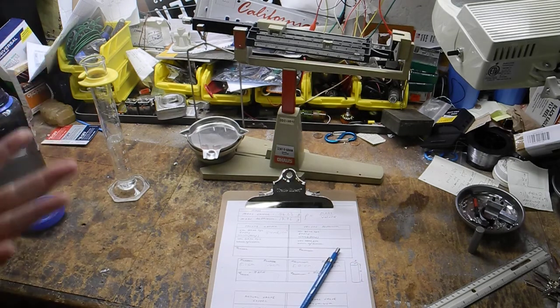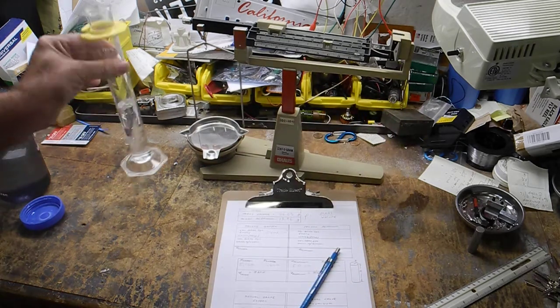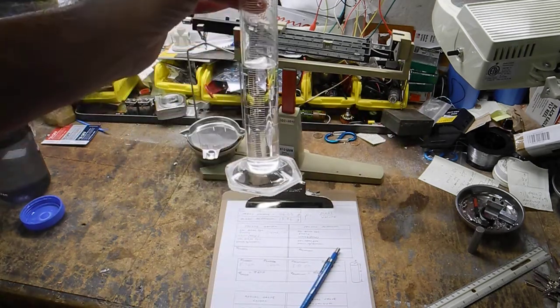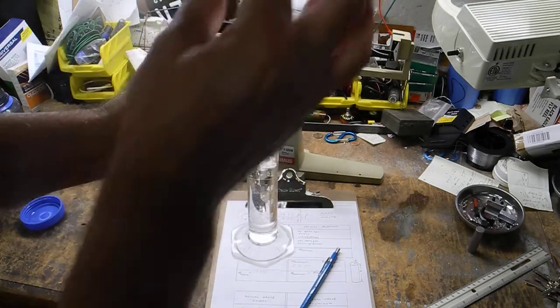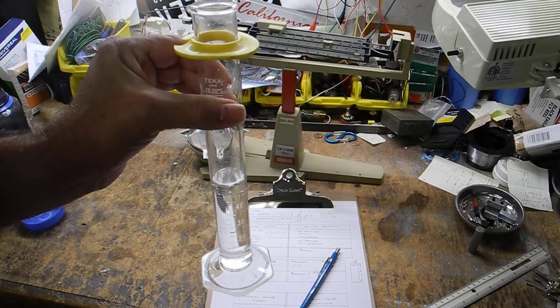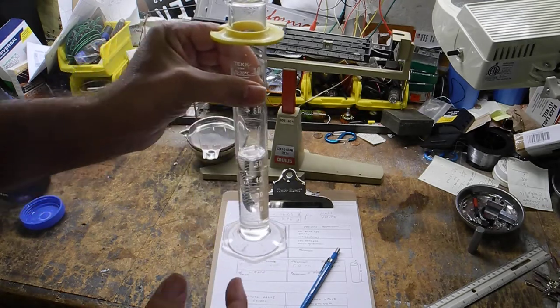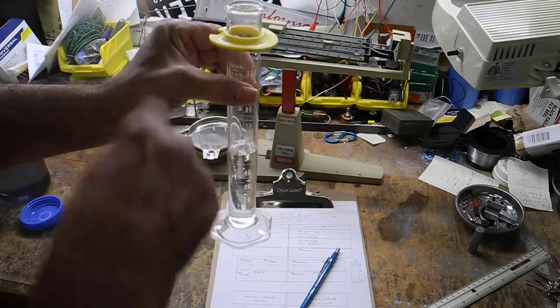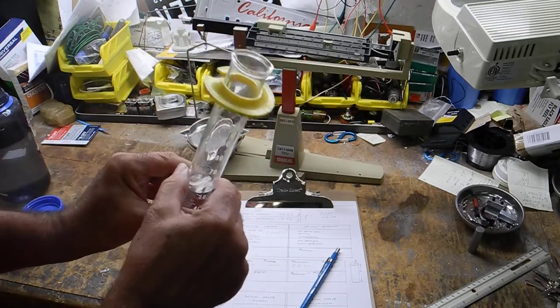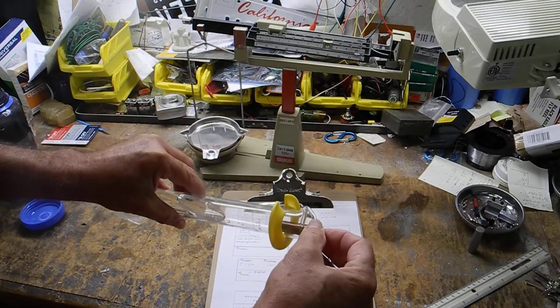and the water level will go up. If you subtract the two, that would be the volume of this copper disc cylinder. So a little something about this. Don't just drop it in there, for two reasons. One, it'll blow out the bottom of this darn thing right here, and water will be everywhere. I've had that happen. Students do that. And the other thing is water splashes out. If you lose water, your lab's messed up. So what we're going to do is tilt it. We're just going to ease this guy in.